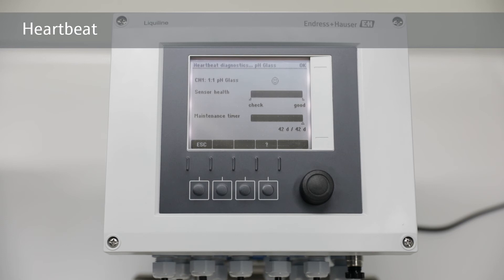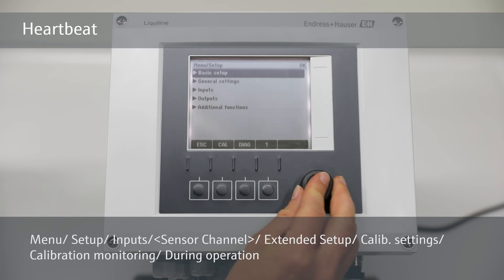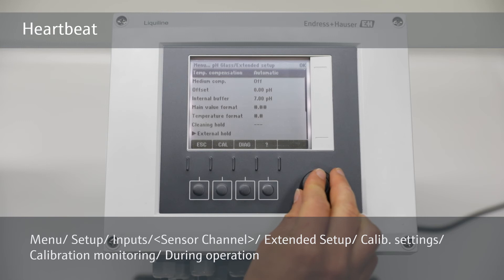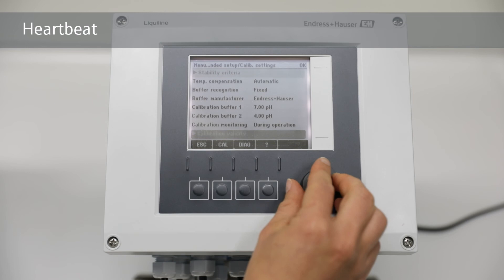To adapt the maintenance timer, go to Menu, Setup, Inputs, Sensor Channel, Extended Setup, and select Calibration Settings, Calibration Monitoring During Operation. Then go to Calibration Validity and adapt the values to the length appropriate for your application.